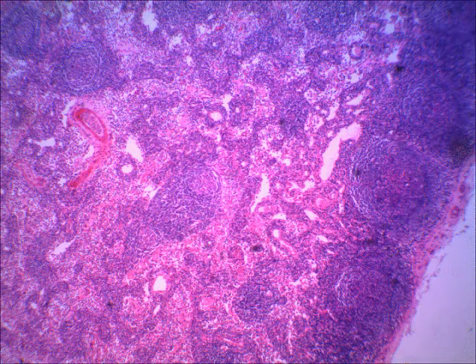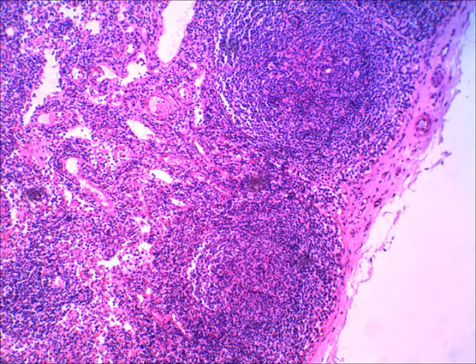All right, if I erase those circles, all of the areas that you see surrounding the lymph nodules and more towards the center of the lymph node, those are just lymphatic sinuses, and that's what the lymph drains through. So you see several spaces. All these are spaces of the lymph sinuses, all of these areas. And again, the lymph drains through that. All right, if we move to the next slide, you can see this on a little bit higher magnification.